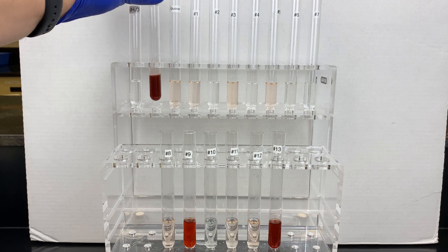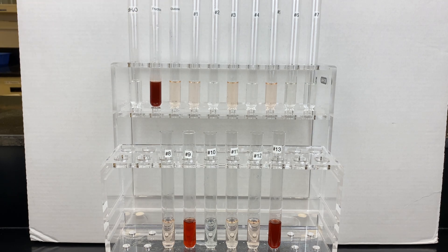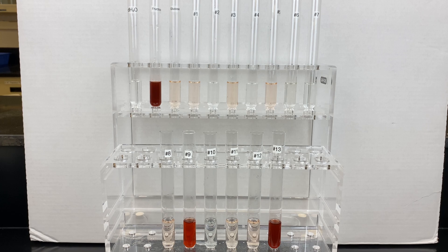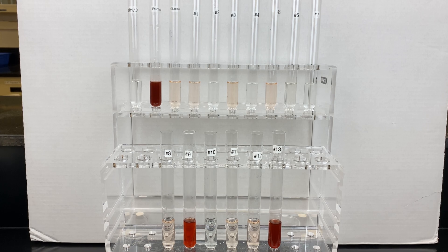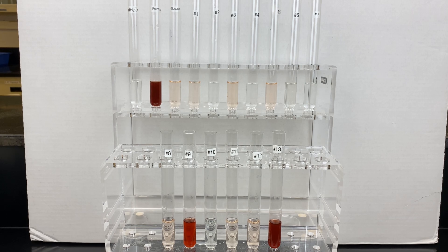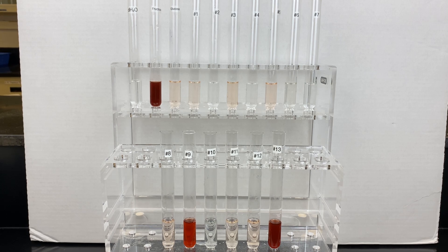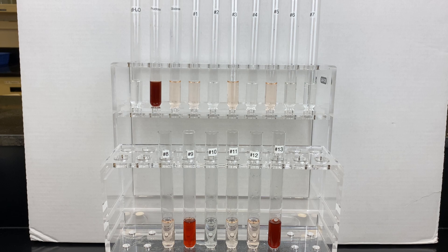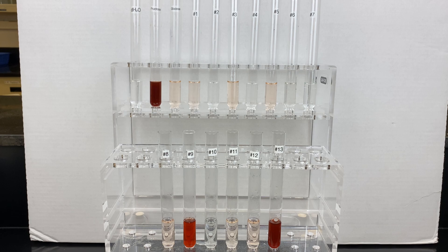This is the last test in the series of tests we're doing for this round of carbohydrates. Taking all the observations from the five tests: Molisch's test, testing whether or not it's a carbohydrate; the iodine test, testing whether or not it's a polysaccharide; Barfoed's test, letting us know if it's a monosaccharide; Bial's test, letting us know whether or not it's a pentose or a hexose carbohydrate; and finally, Seliwanoff's test, letting us know whether or not it's a ketose or an aldose carbohydrate.